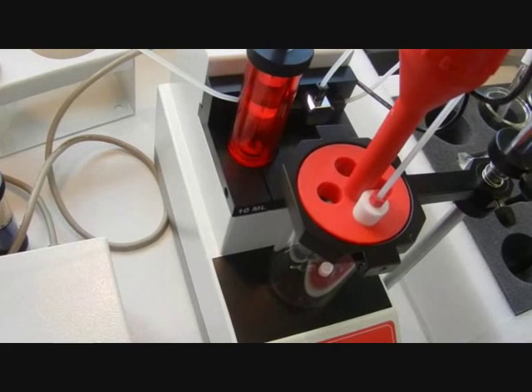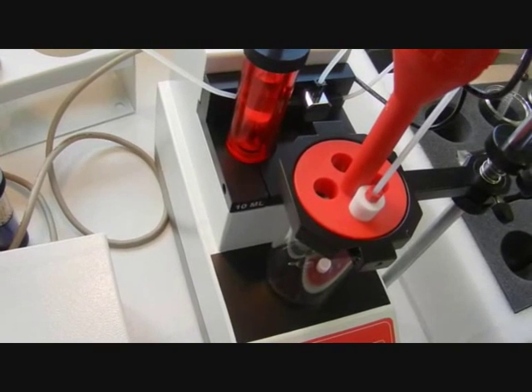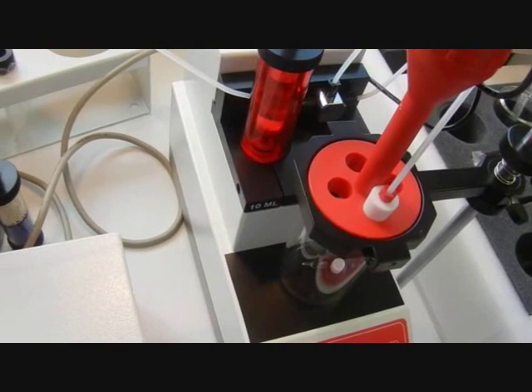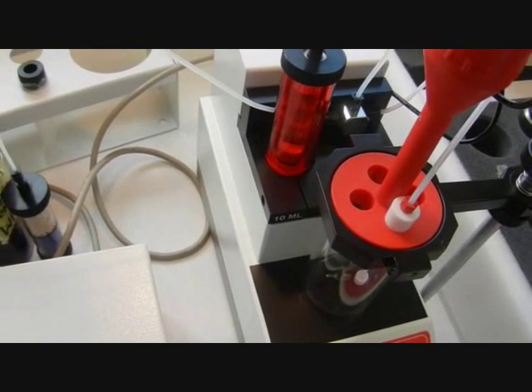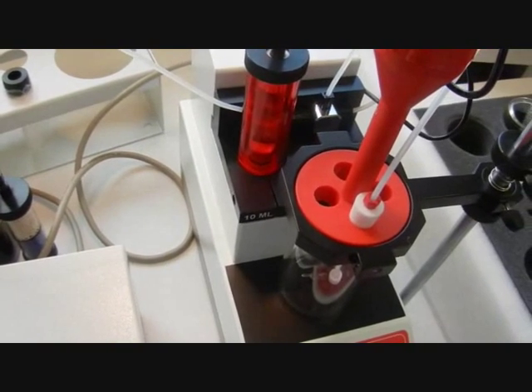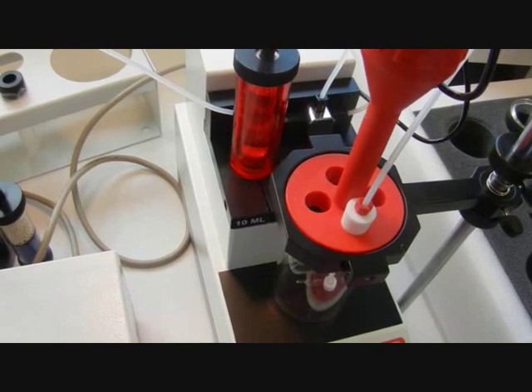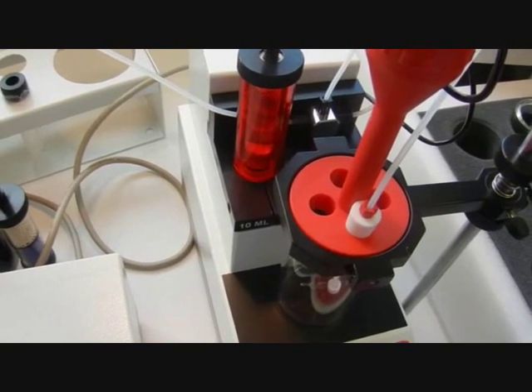You can see the burette is now filling from the titration bottle and it will prime all the tubes just by pushing that 10ml into the titration vessel.